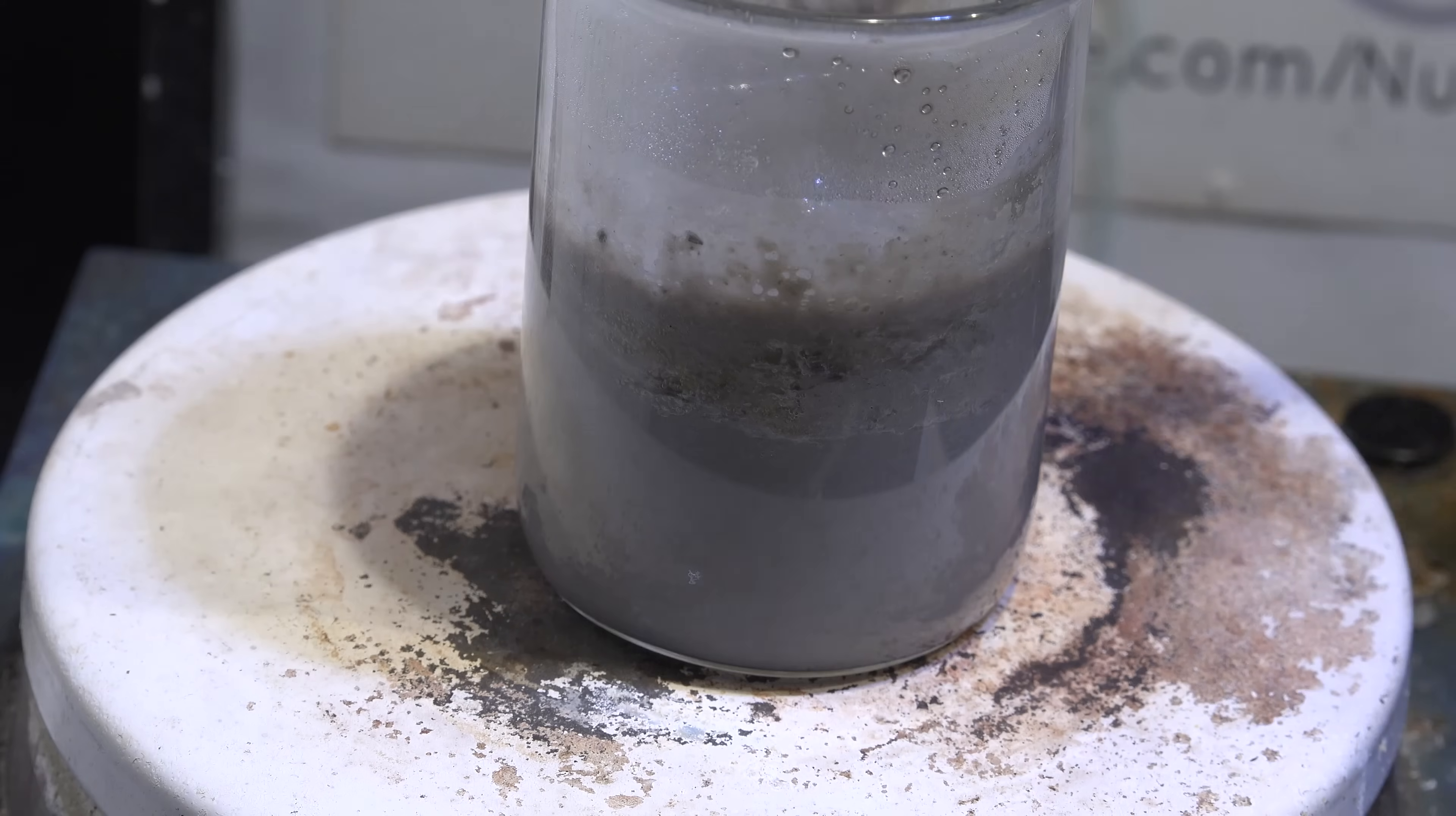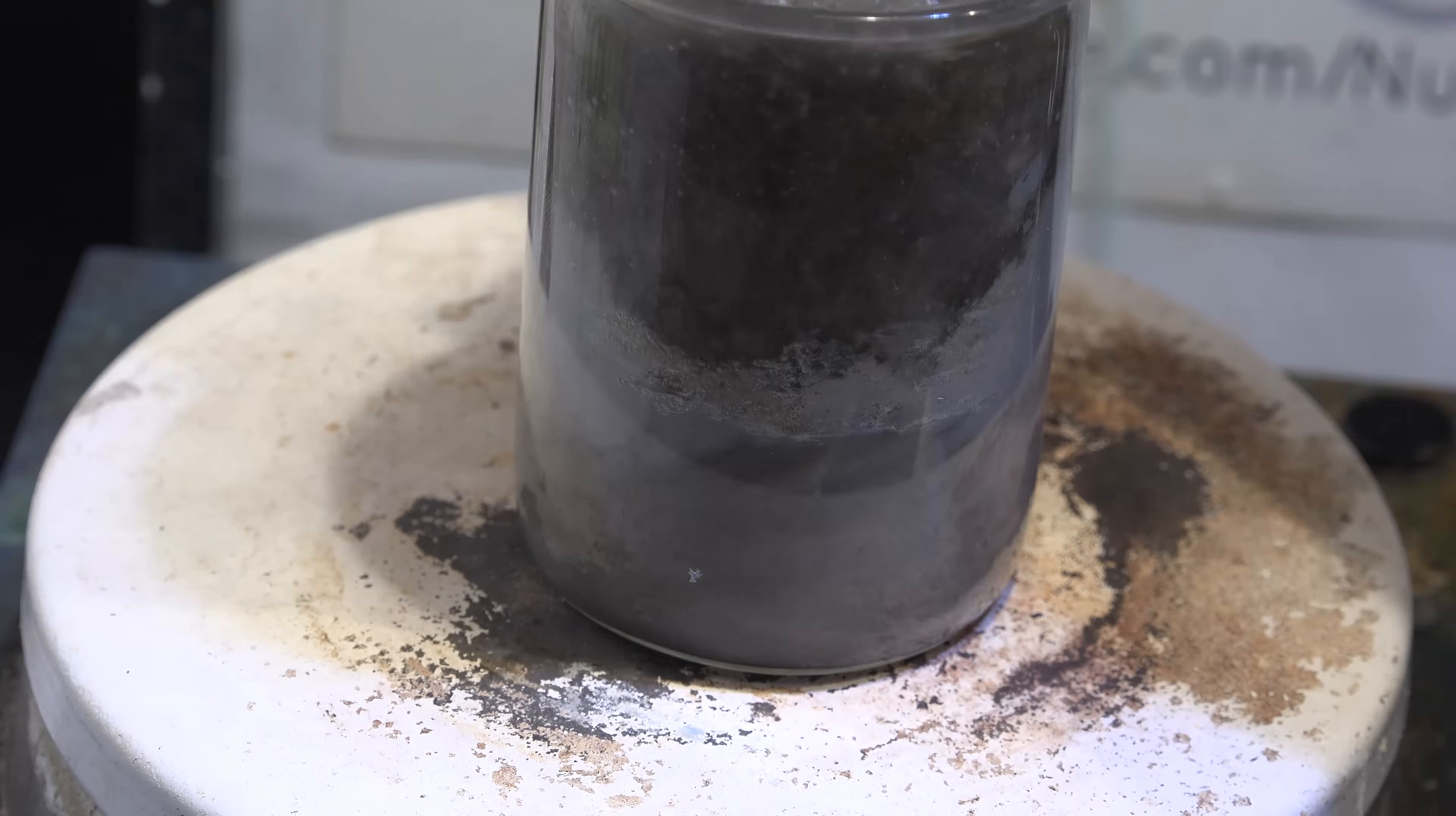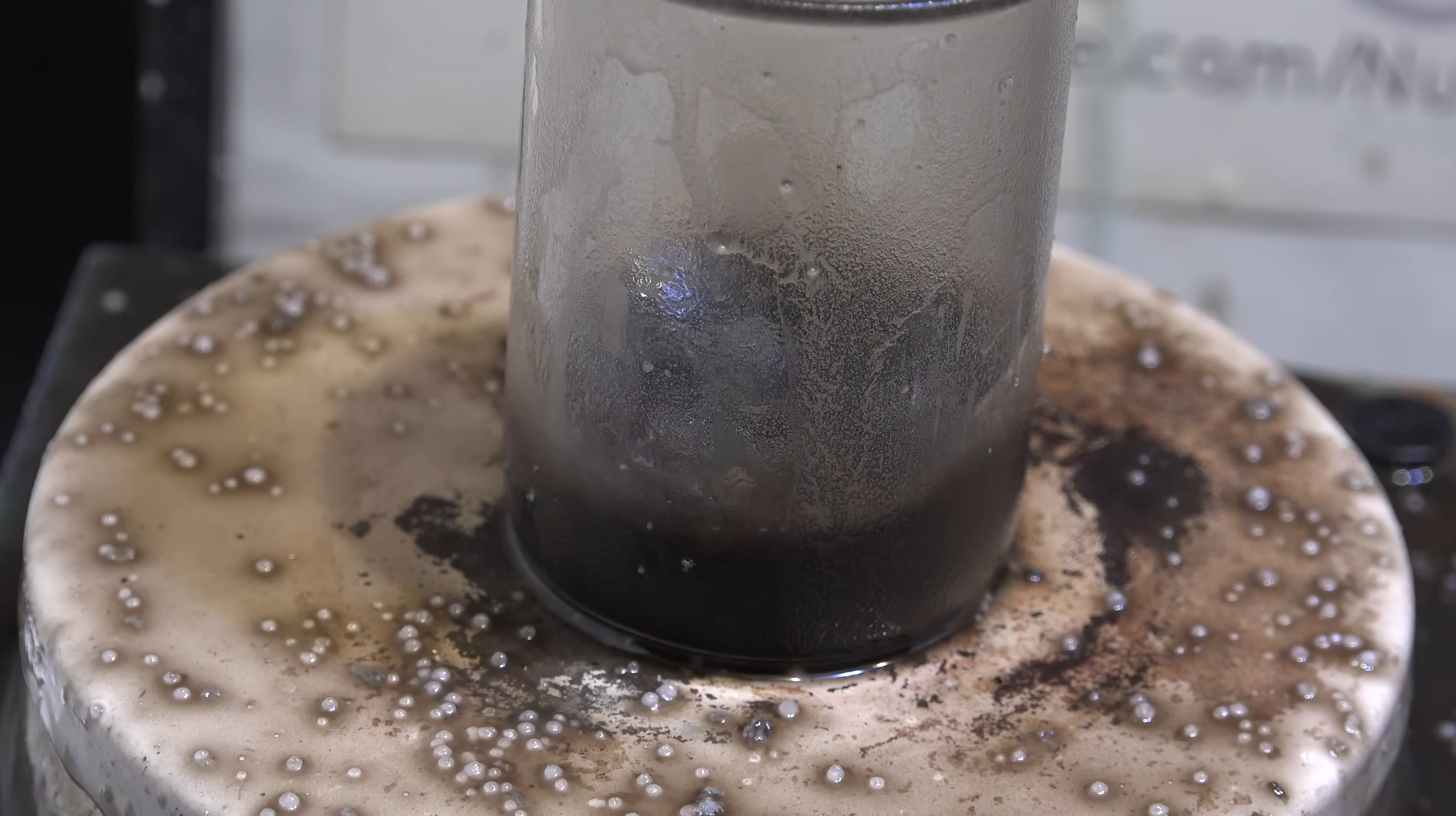Now at this point I made a major fail. I added in too much sodium hydroxide at once and the solution got so hot that it boiled over. All that work destroyed in the blink of an eye. This was the kind of mistake I yelled at my students for doing back when I was a chemistry TA.